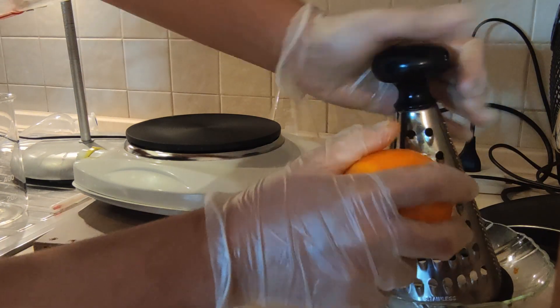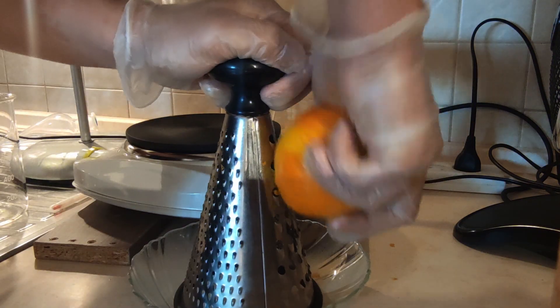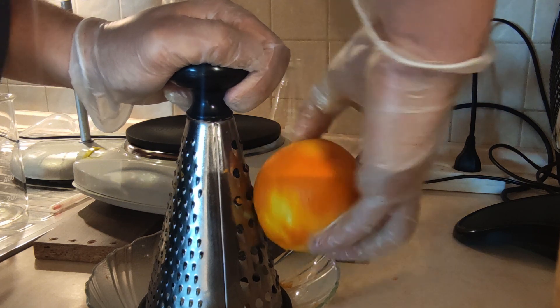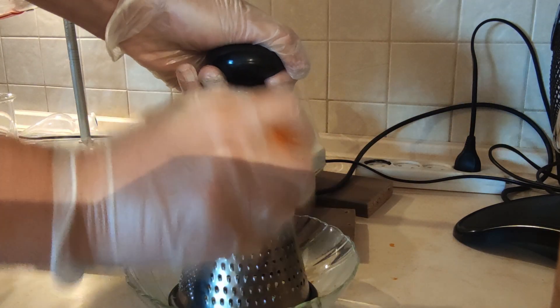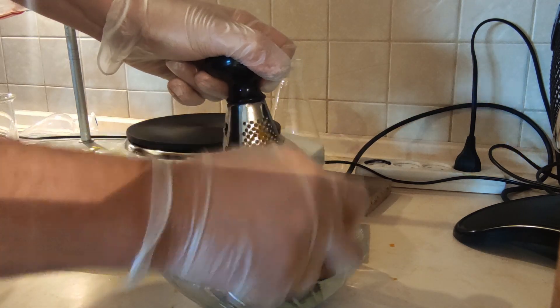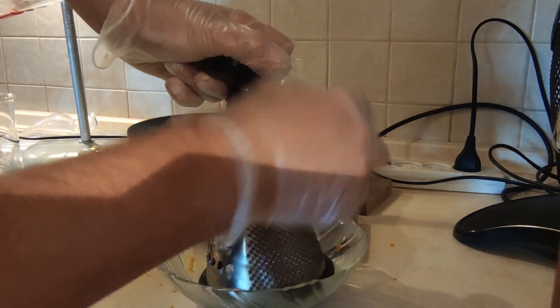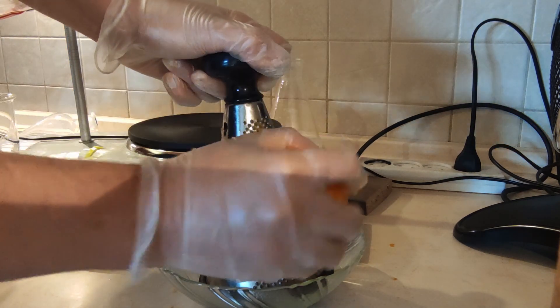First, I treated the oranges with a grater to remove the outer part of the peel, known as zest. It is the zest which has the highest concentration of limonene. This part was very long and tiring — I could have done it the easier way and just used a blender on the peels.